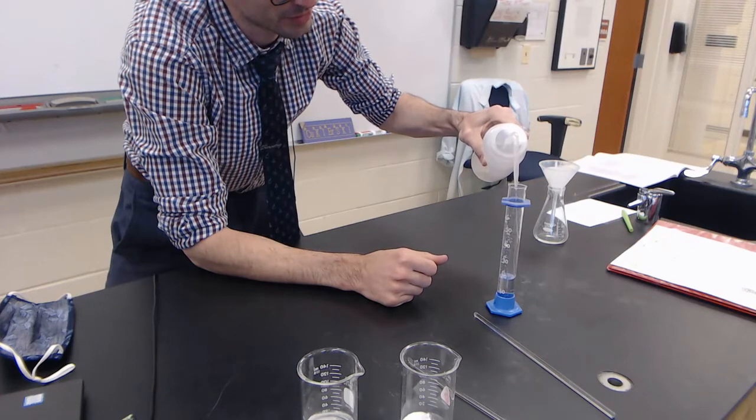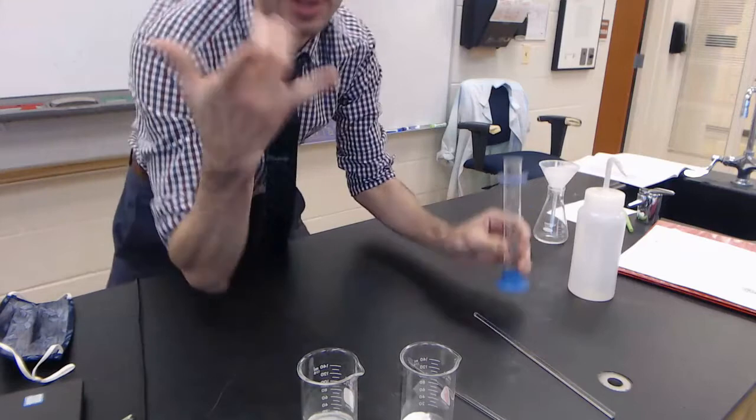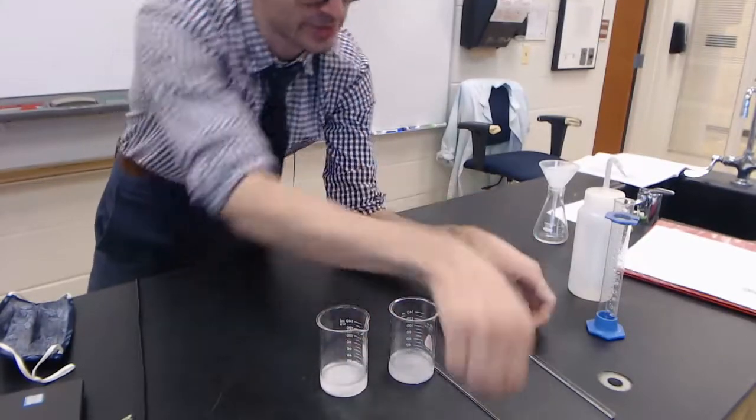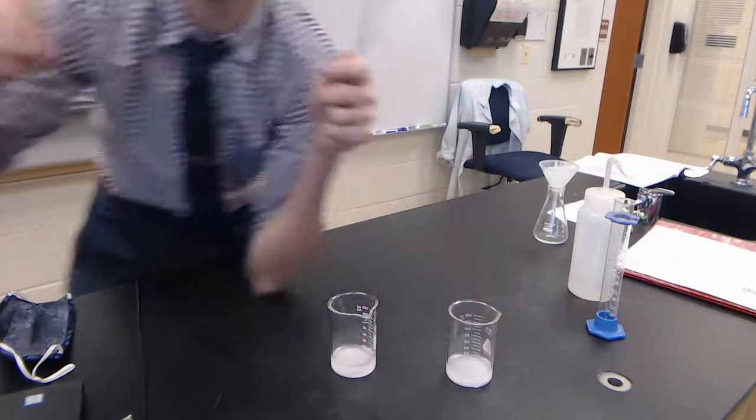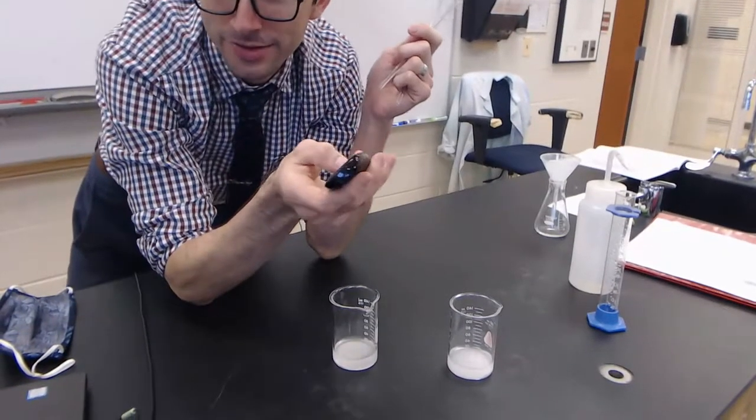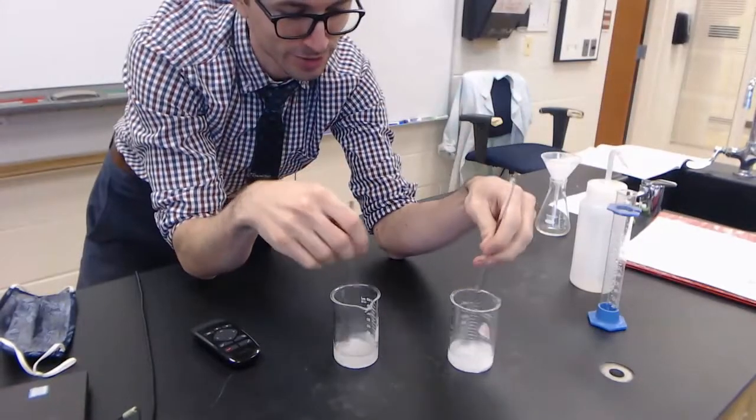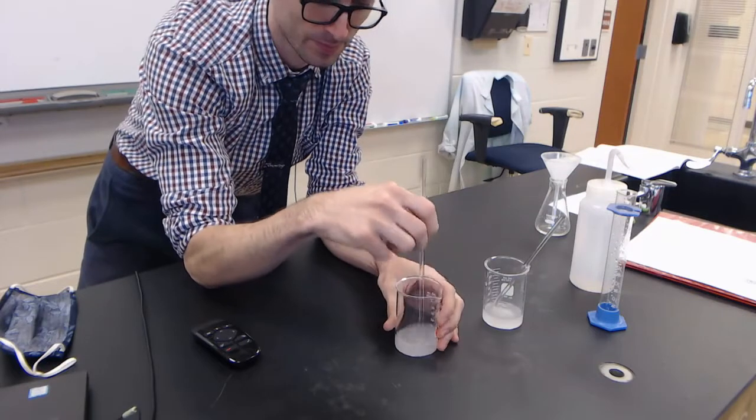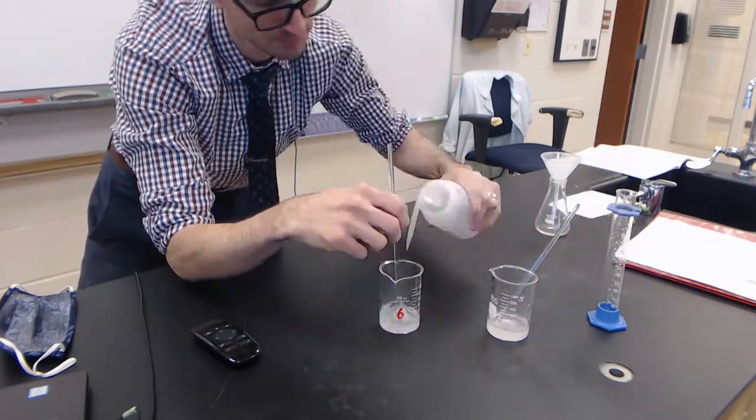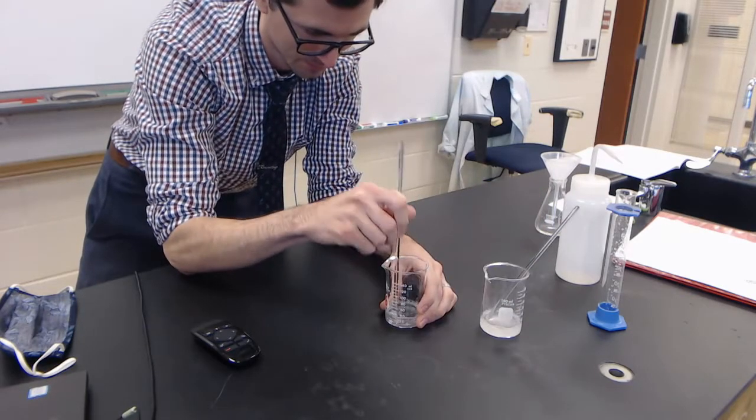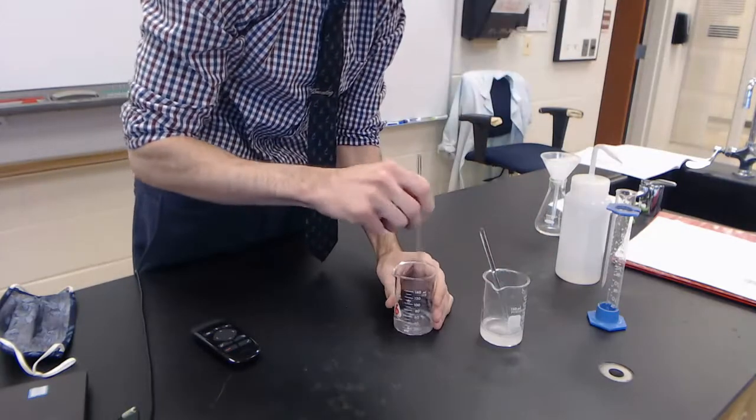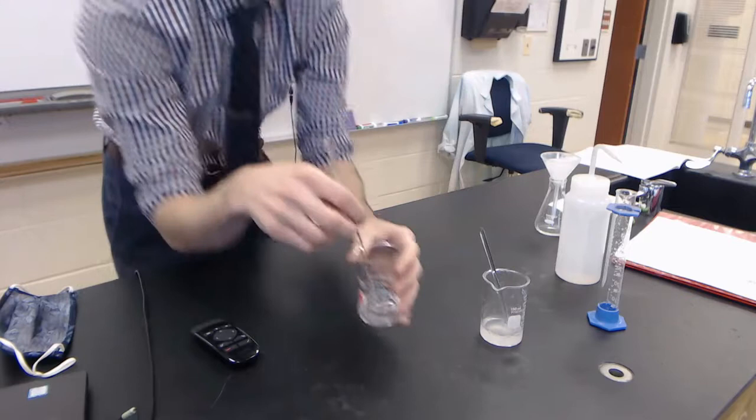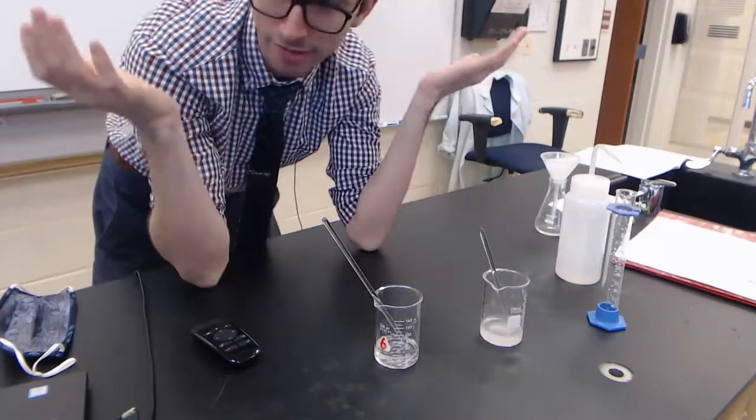This is just used to dissolve it, because adding two solids to each other won't make them react. They both need to be aqueous solutions in order to react. The ions have got to move around and hit each other. So water's added, time to stir. You can see there are still little bits of solids in there, but we just need to make these two solids dissolve in the water.